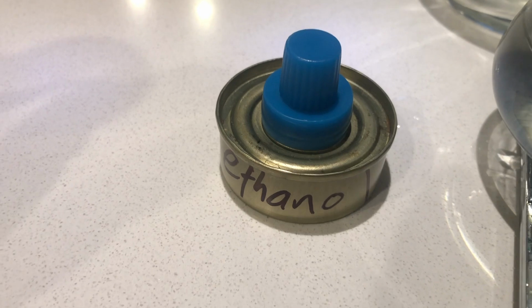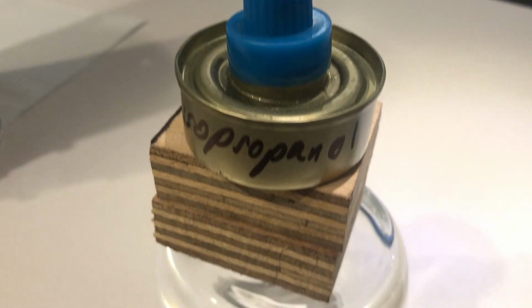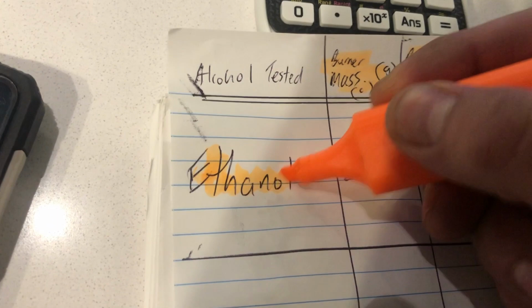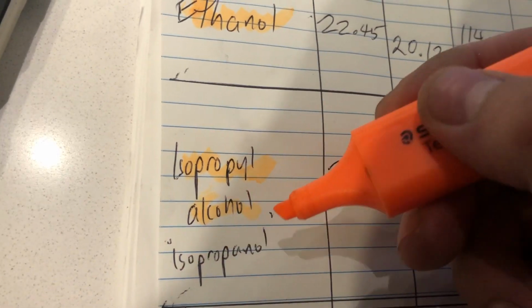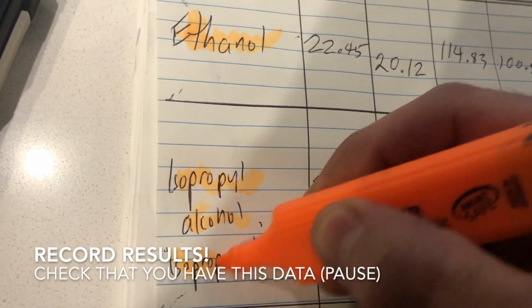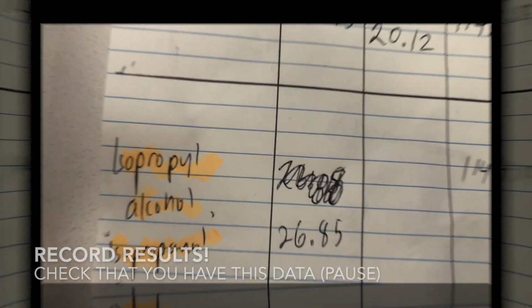Last time we tested ethanol, and now we are going to test isopropanol. You heard that, folks? Ethanol was our last experiment. Now we're up to isopropyl alcohol, commonly used for nail polish remover or sanitizing your hands, so is that. And we're going to call it isopropanol to be a bit more technical with our chemical names.